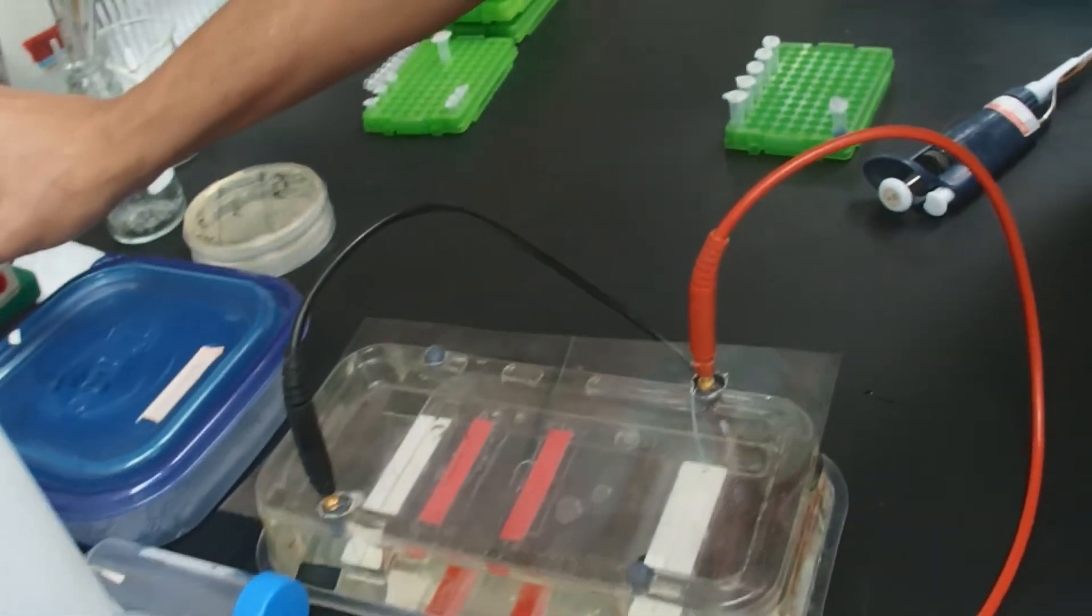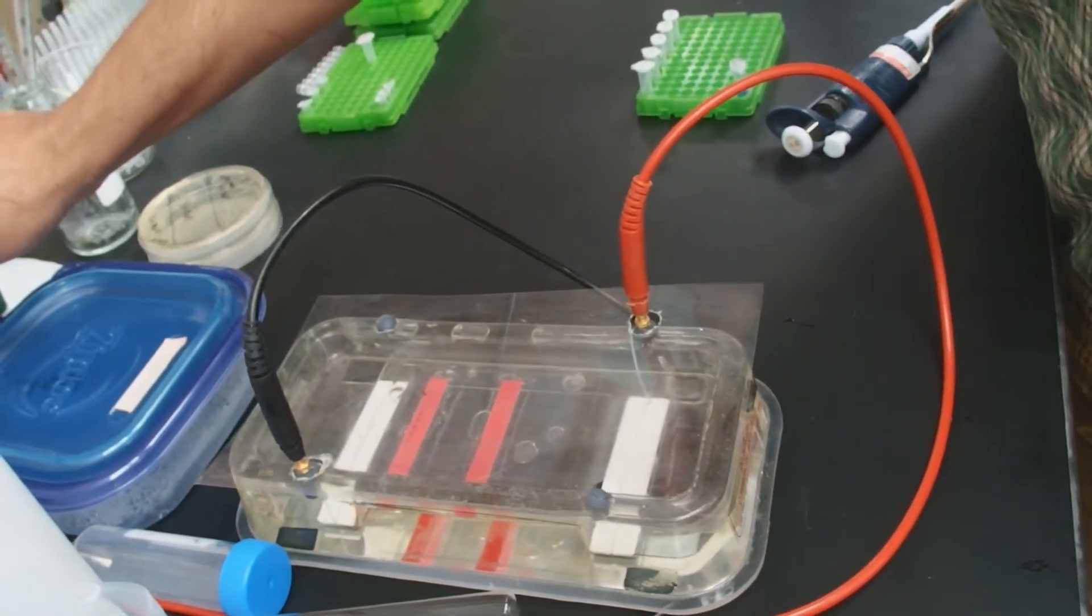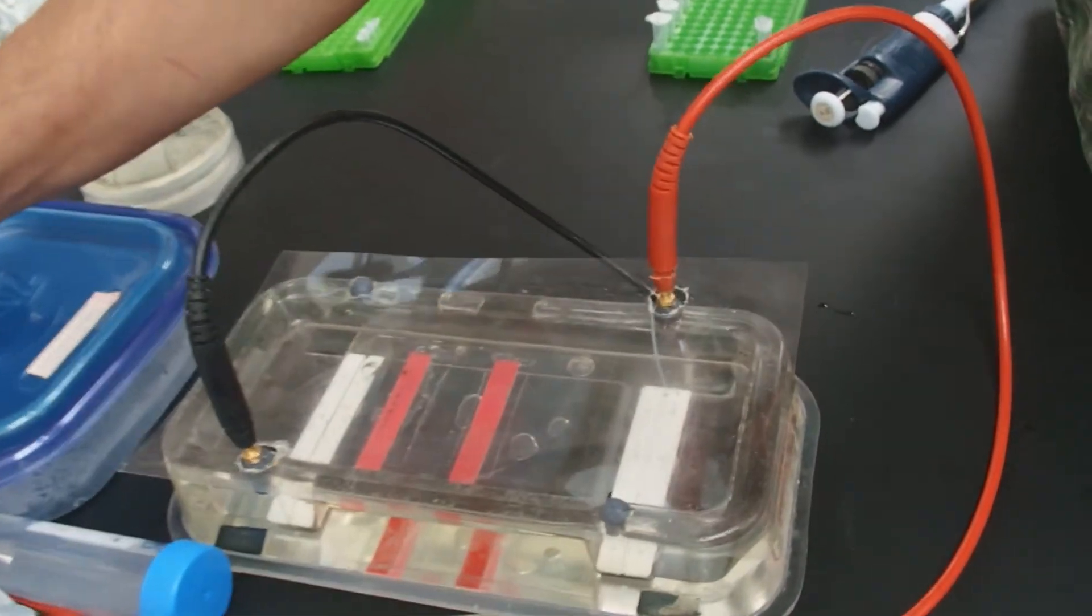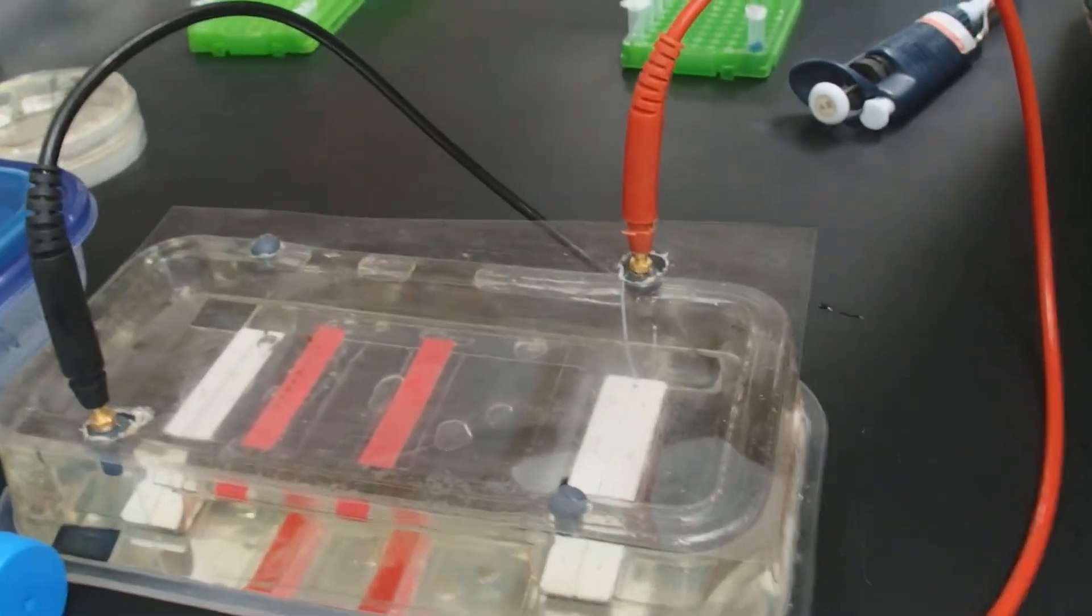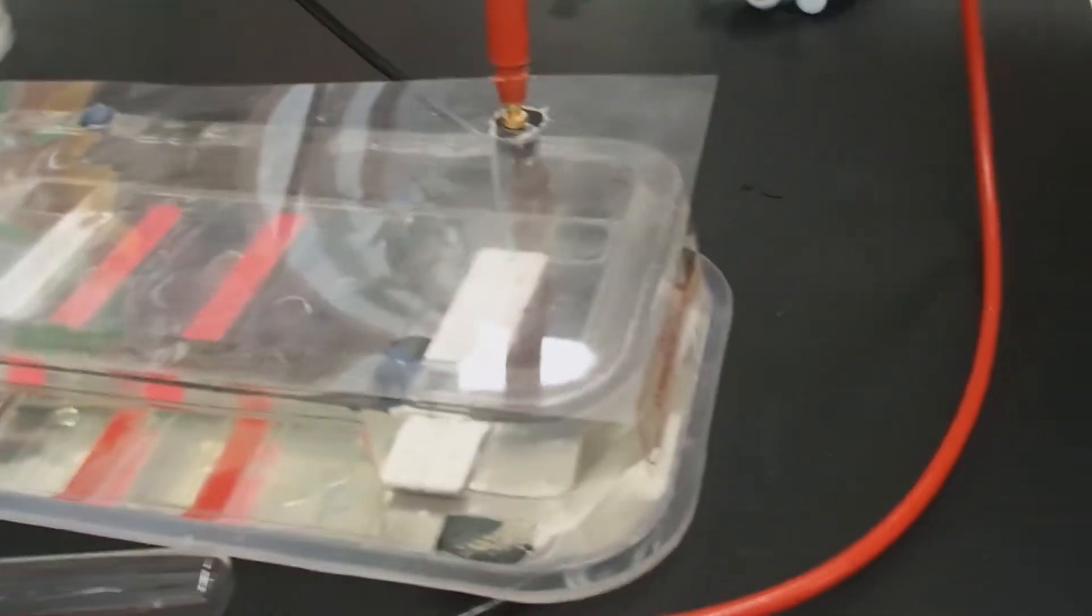I run these gels really fast. I run them at 300 volts for seven minutes exactly. This way we get our results in seven minutes only. I always set the timer on the power supply so you can walk away from this thing and nothing much will happen.